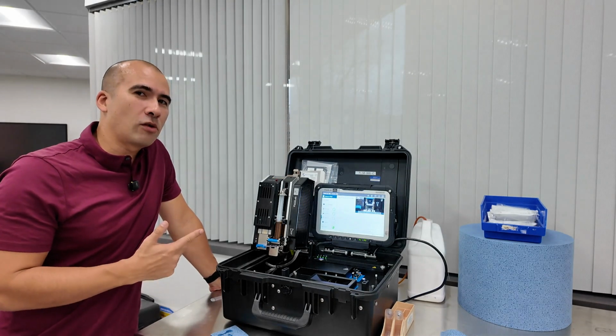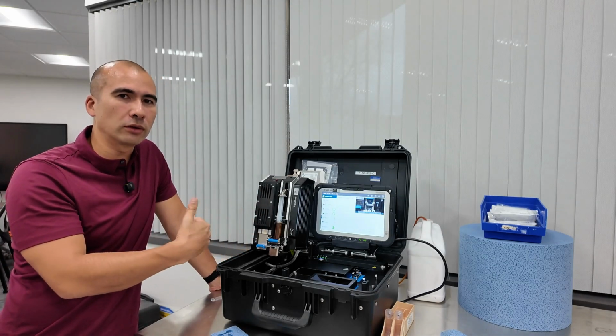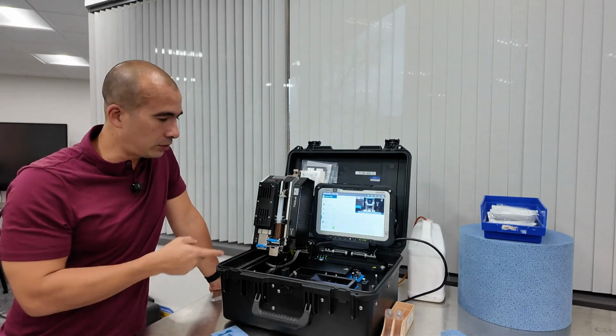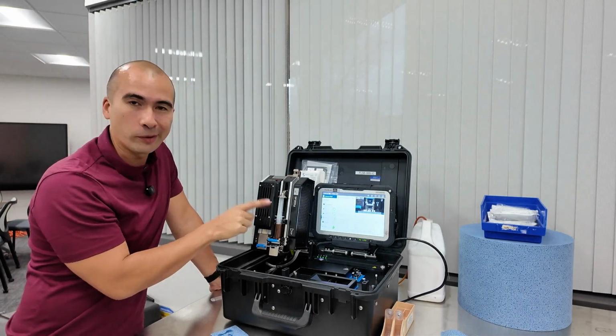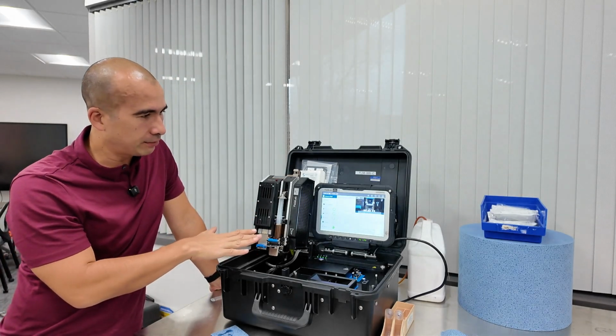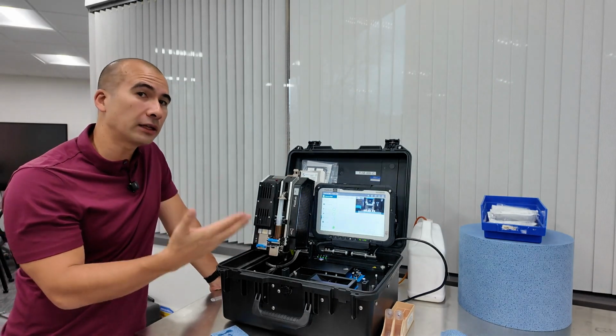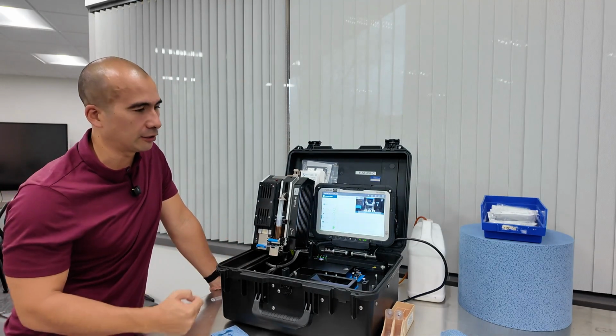Now this is a pretty clean oil sample, so we're expecting that probably most of the volume is going to go all the way through. If you had a highly contaminated sample, it might already register the pressure differential when we've maybe only used up half the sample or something like that. But as that's measuring, it's going to give us the particle counts, and then we'll be able to take the filter and then put it in the XRF machine.